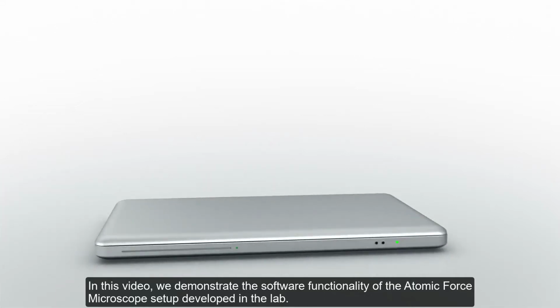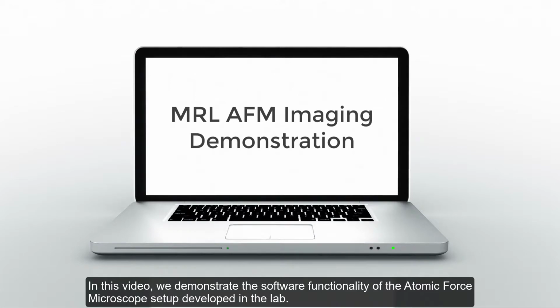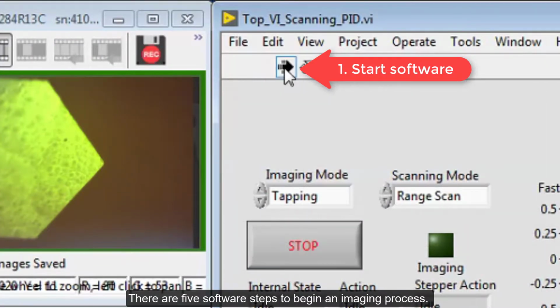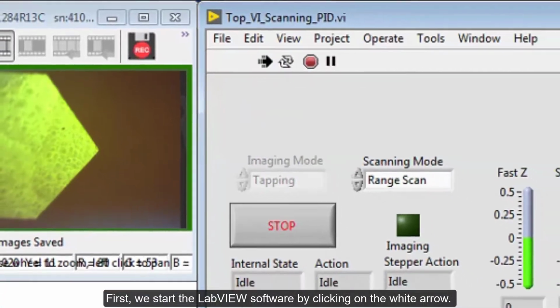In this video, we demonstrate the software functionality of the Atomic Force Microscope setup developed in the lab. There are 5 software steps to begin an imaging process. First, we start the LabVIEW software by clicking on the white arrow.